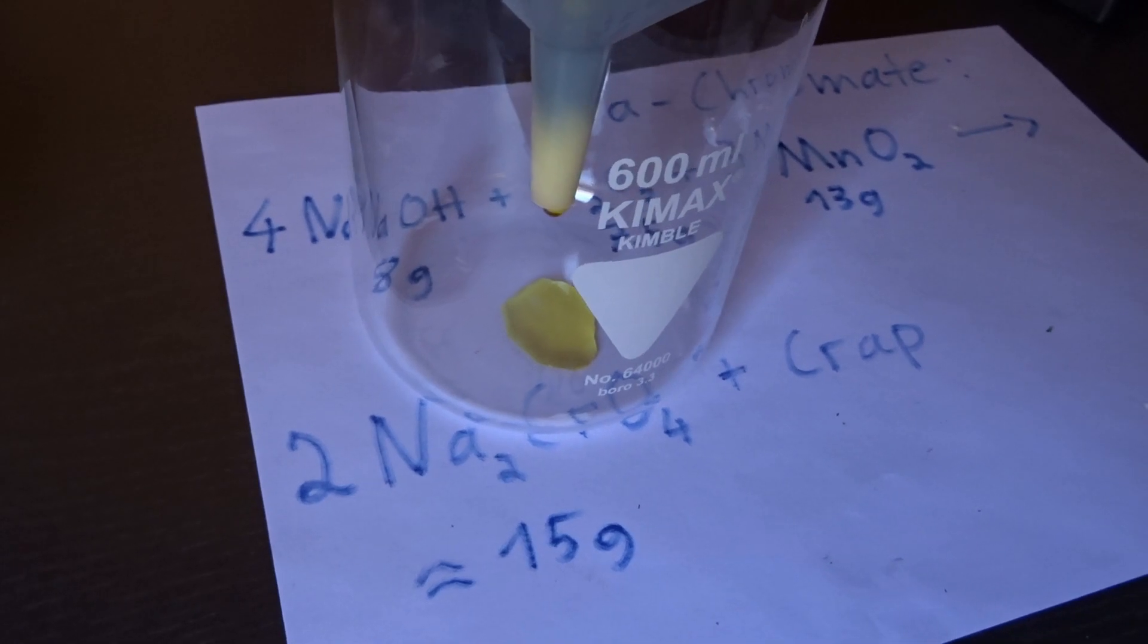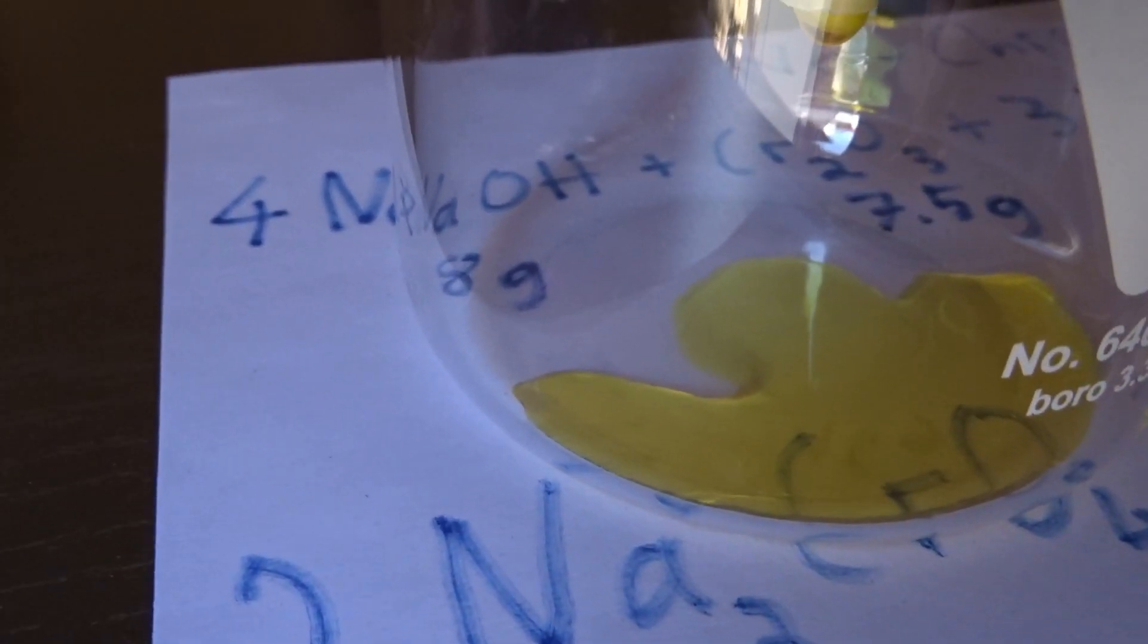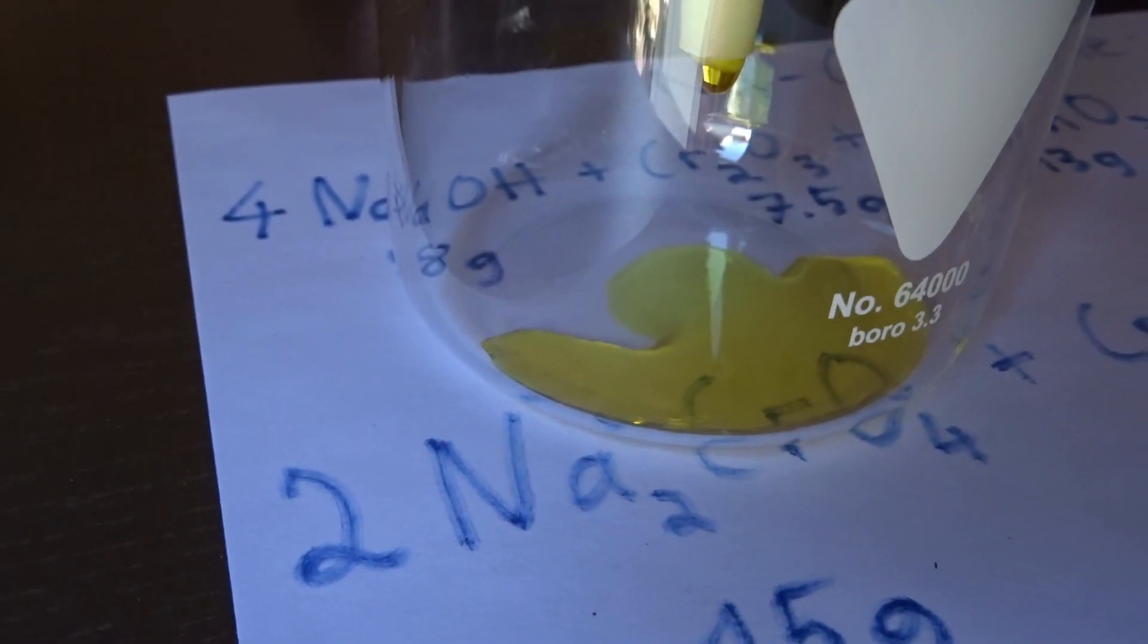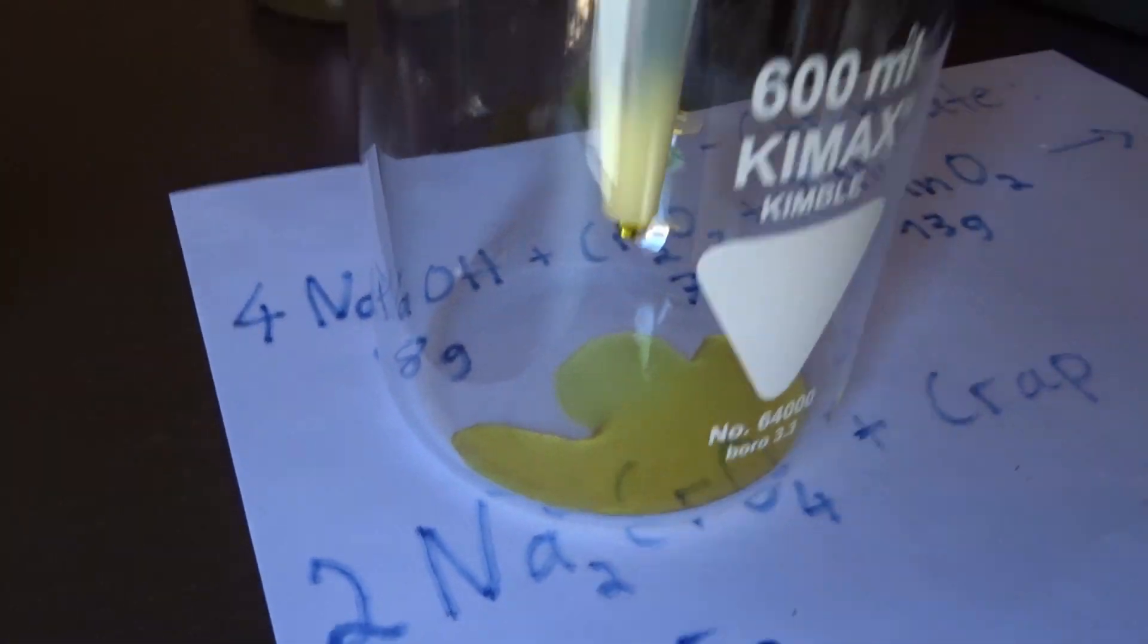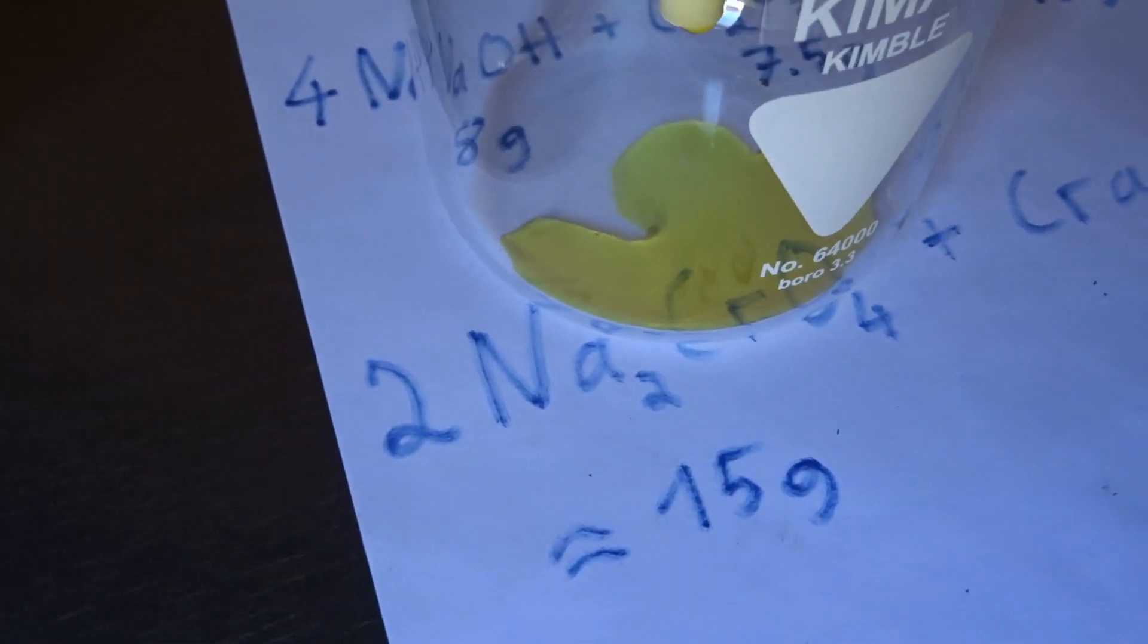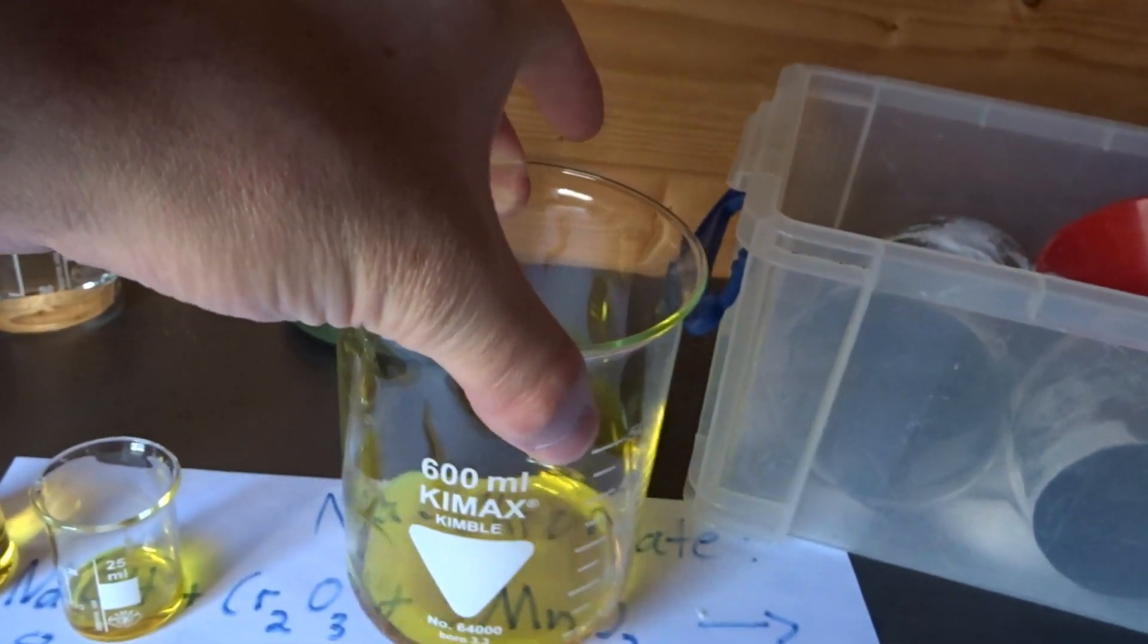There it goes. Chromate drop after chromate drop. And some interesting experiments will follow very soon if this is done. And the filtering is done. Here is the chromate. Quite a bit actually.